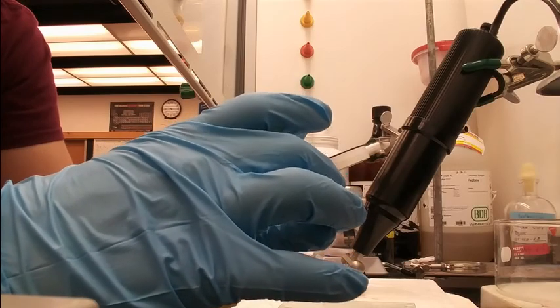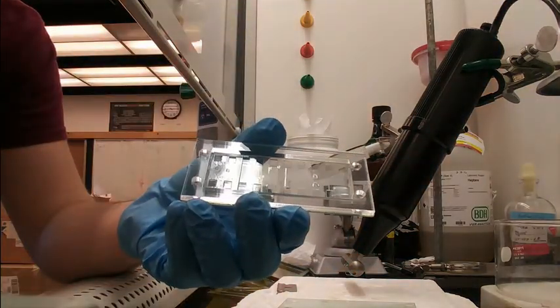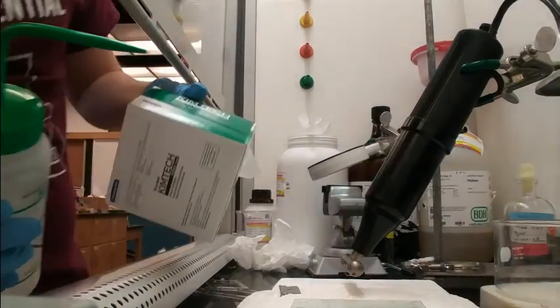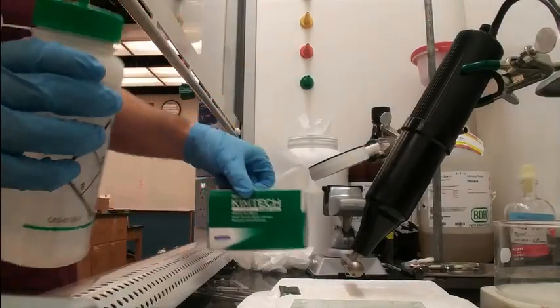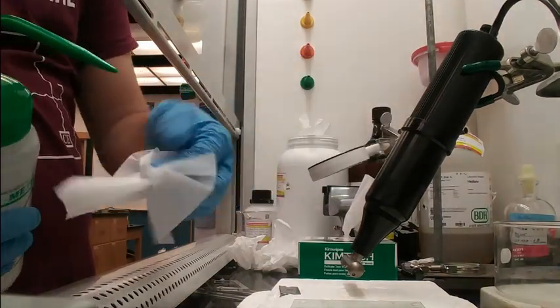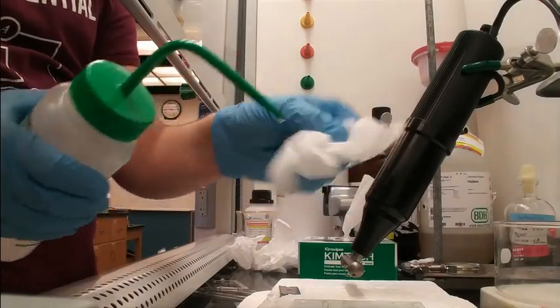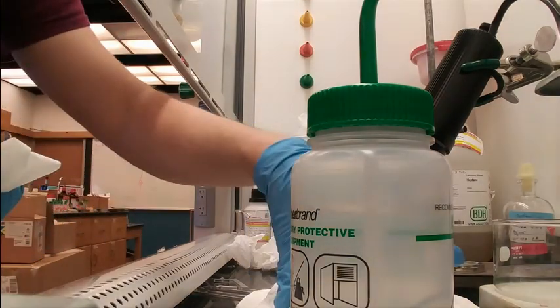Be careful not to drop it in this process, as any dust will impede the corona discharge sealing. Once the PDMS is removed and on the glass slide, we will wipe both sides of the bonding step, which includes the conductive side of the FTO and the Kapton-facing side of the PDMS, using a chem wipe soaked in methanol. This will remove any dust that accumulated and allow tight sealing.